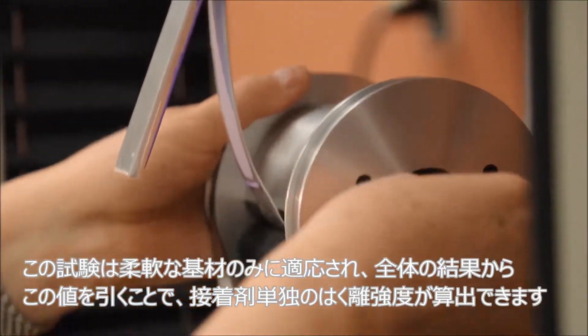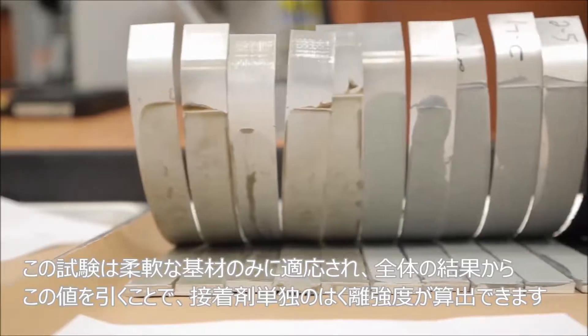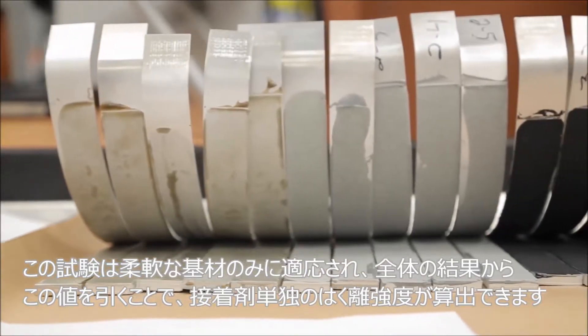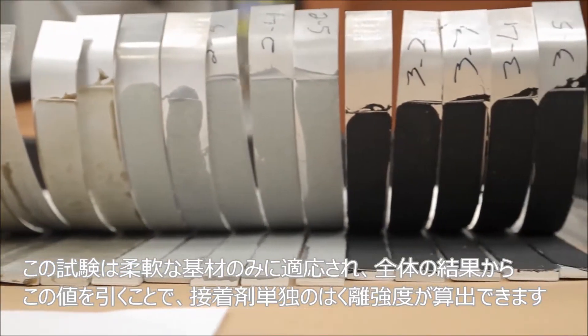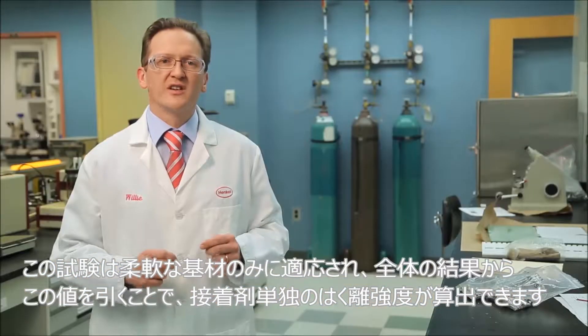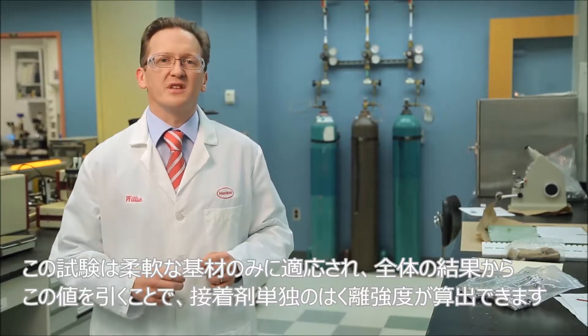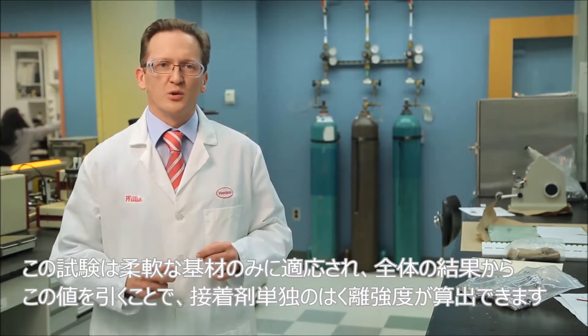The test can be run using only the flexible substrate, and this value is subtracted from the combined result to provide the peel strength of the adhesive alone.